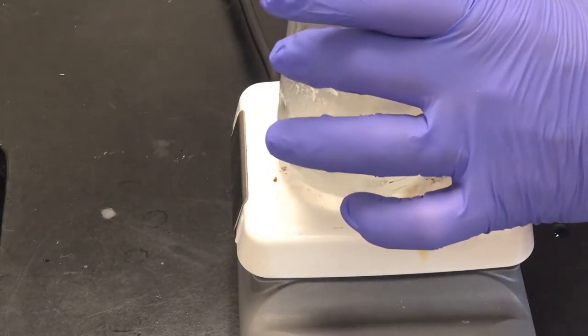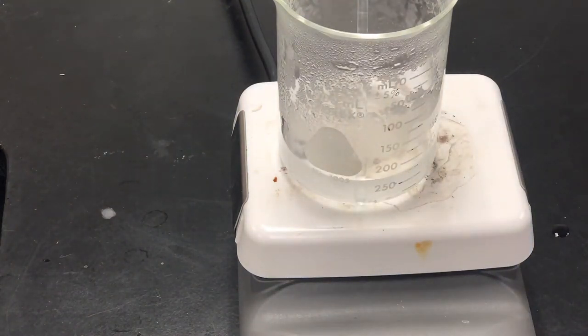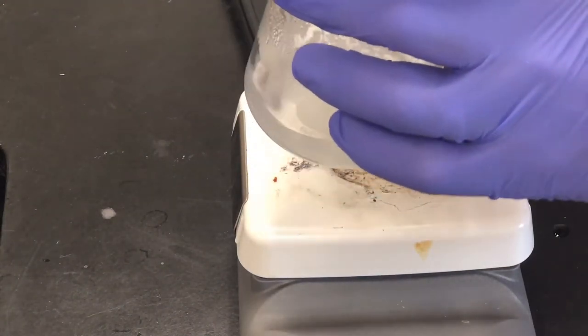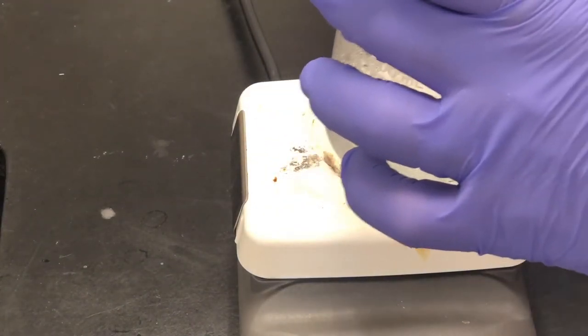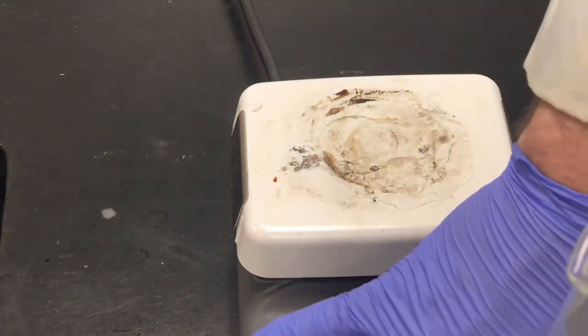This is all going to happen in this next clip. So being efficient while you're doing this really moves this along. This has taken at least five minutes to slowly bring this up to temperature to get these white crystals to dissolve without letting it boil. That's one of the things you definitely want to get good at when working with a lab partner.